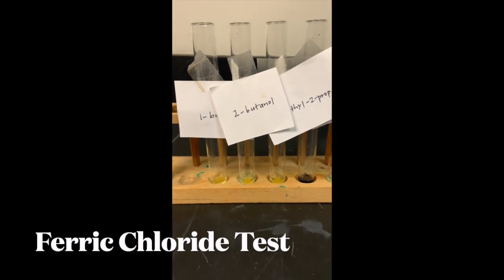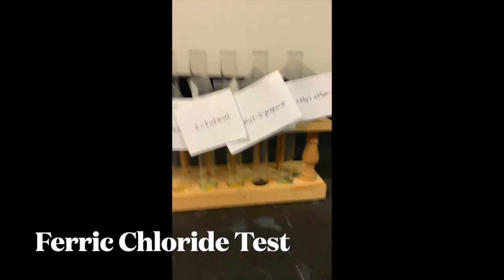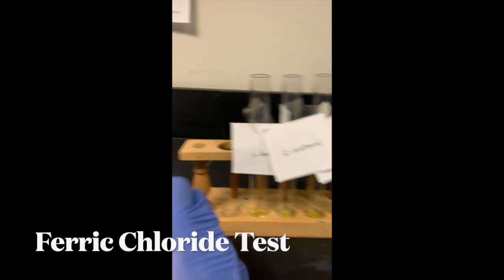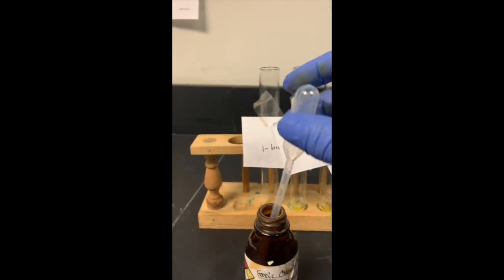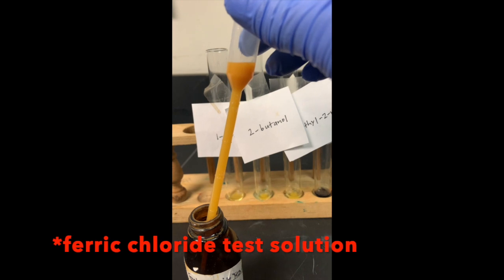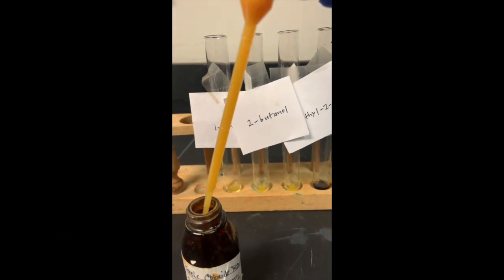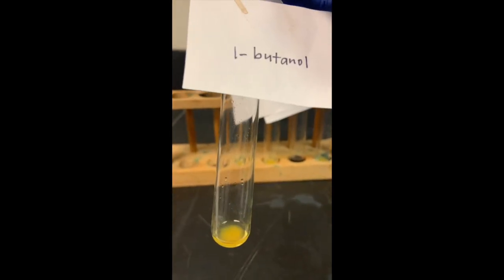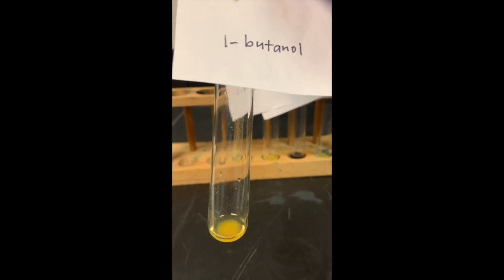So for the sake of time, I already added the amounts that I needed to my test tube. I have 10 drops of each of these and 2 drops of my ferric chloride test. I just want to show you what the ferric chloride test looks like. It looks like Sunny D or orange juice. And when I added it to my test tubes, I see no color change. It's basically just that clear liquid mixed with my Sunny D, aka my ferric chloride.